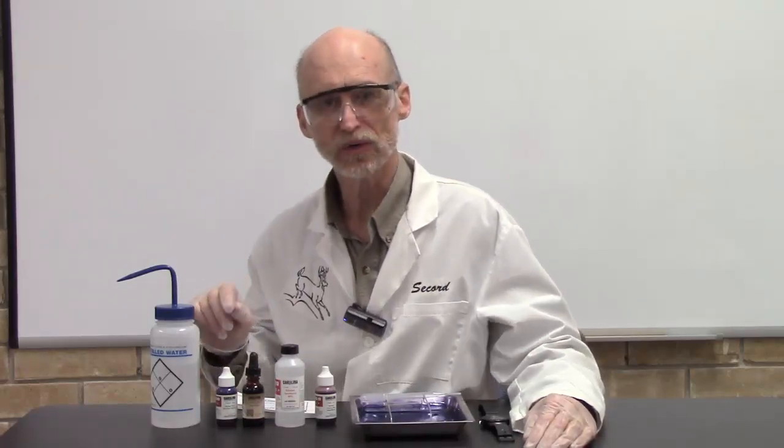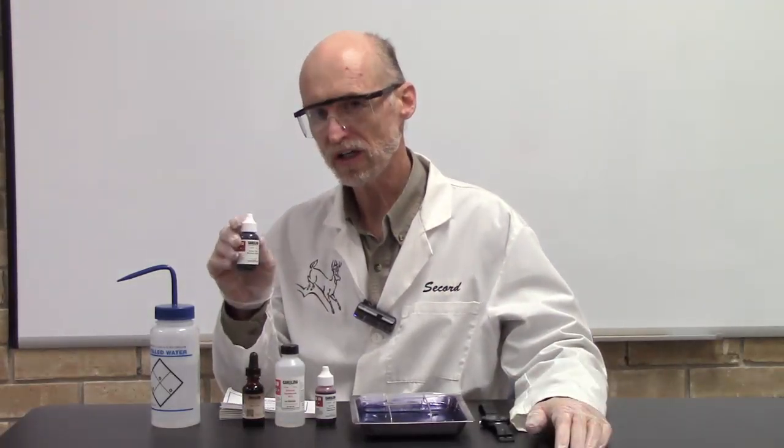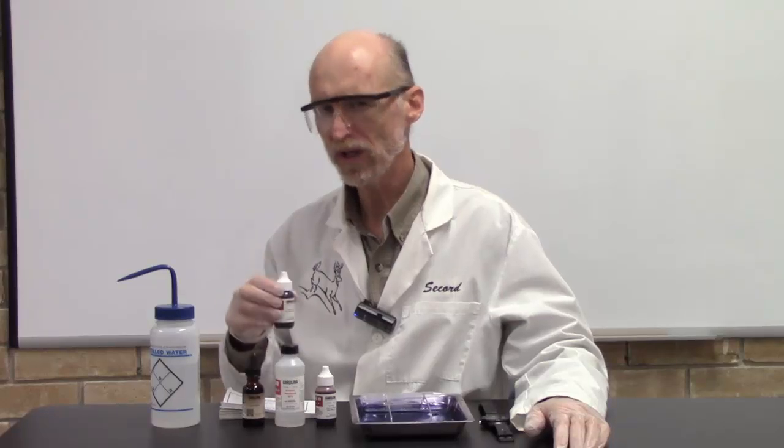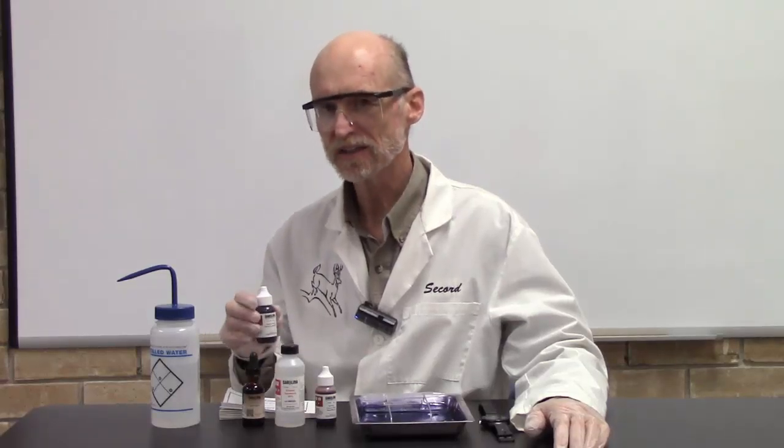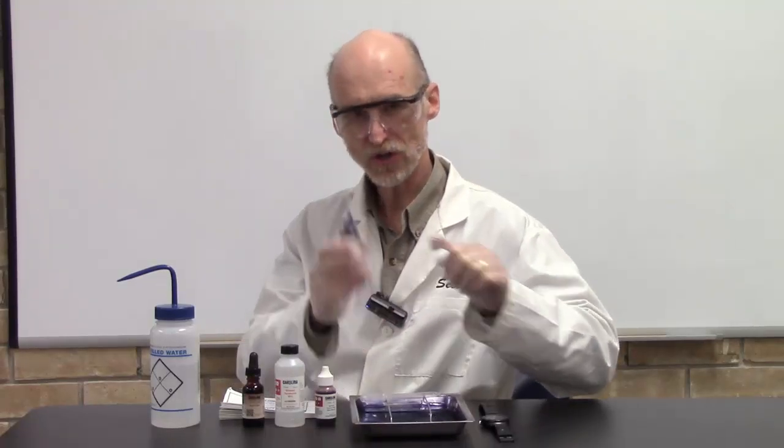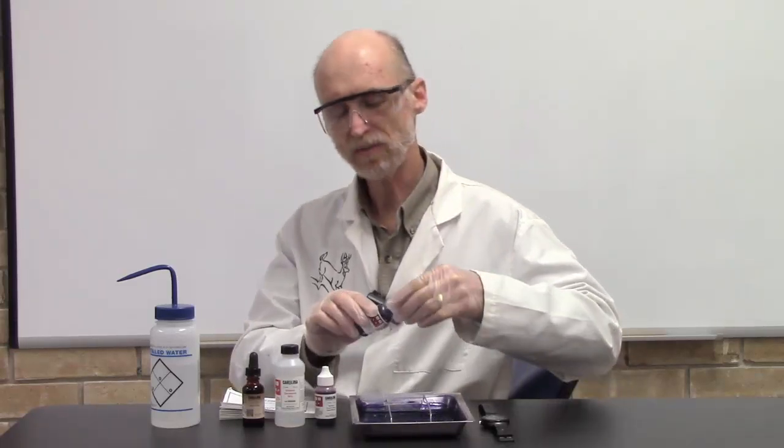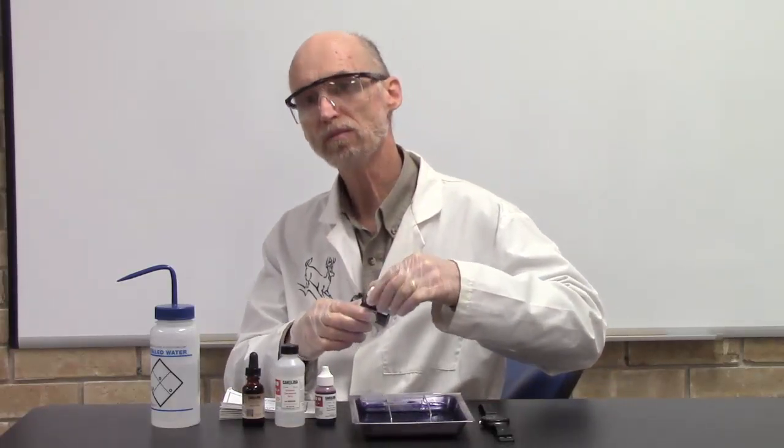Let's actually go through the technique. I'm going to accelerate the times—I'll tell you how long you should leave these on, but just so the video won't be really long I'm not going to actually leave them on that long. First you apply crystal violet to your bacterial smear, just a couple drops. I'm going to leave that on for one minute.